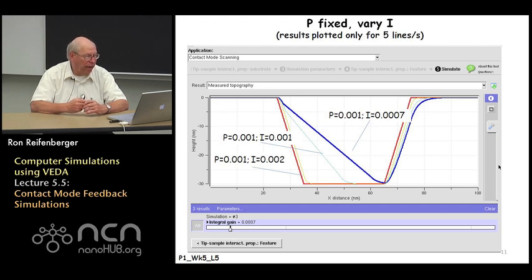In this example, I choose the 5 line per second scan speed. Now I systematically adjust the proportional and integral gain, and you can see that by adjusting P and I in a rational way, you can actually find optimal feedback parameters that do a reasonably good job of reproducing the topography of this trench-like feature.